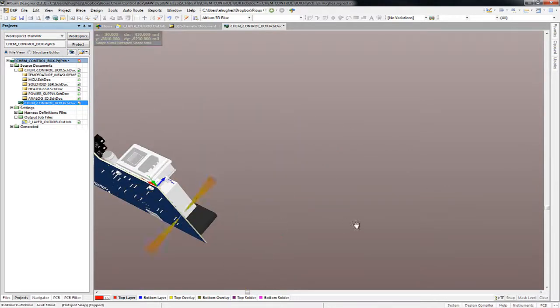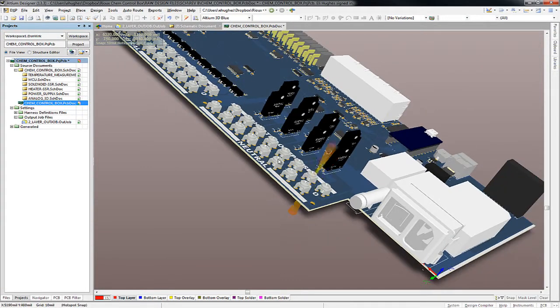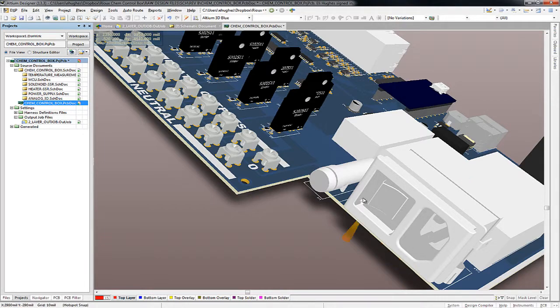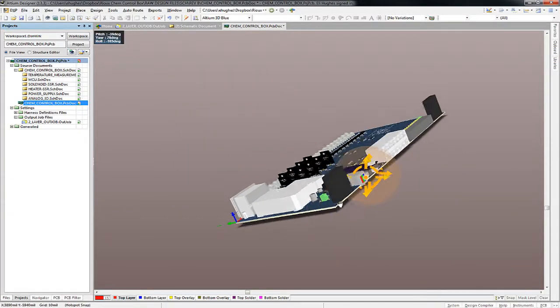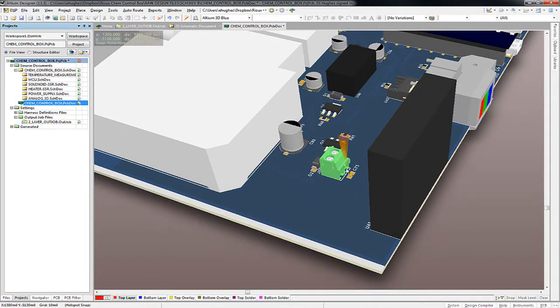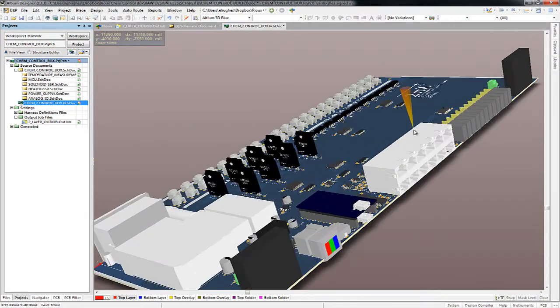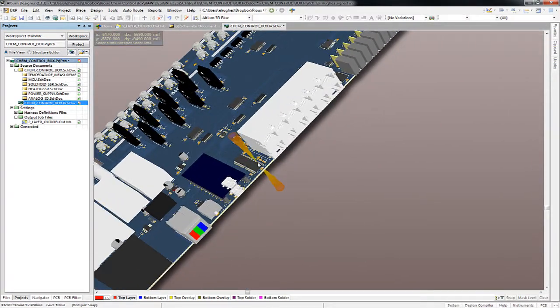Now, on the back of the box, the idea is the back plate to the rack mount enclosure will have an opening that will allow these screw terminals to come out so you can attach your 120 volts AC outputs. You can see the 120 volts AC input, a switch, and a fuse. So that's pretty much the board design. The only other note is that the fans have discrete wires. You're going to be able to wire the fans into some screw terminals on the main board. Everything else on this board are just the raw components you need to populate the board. As you're building it up, you'll see those. But that's the I/O for the circuit card.